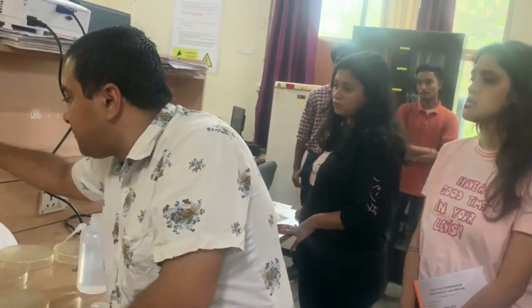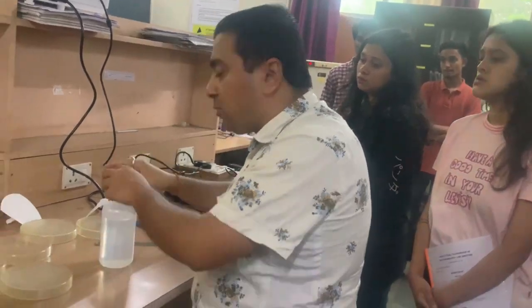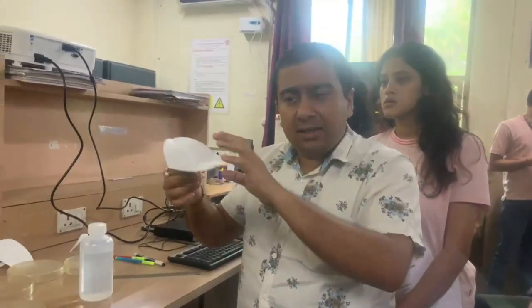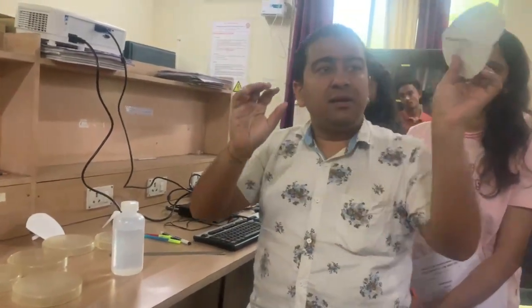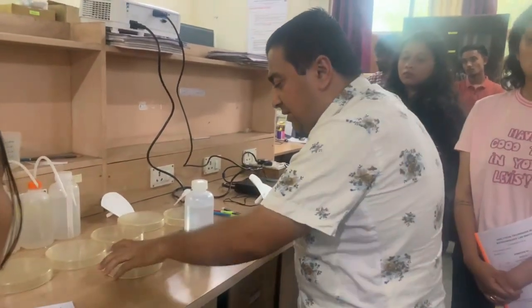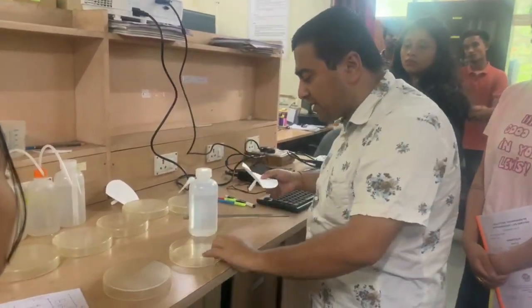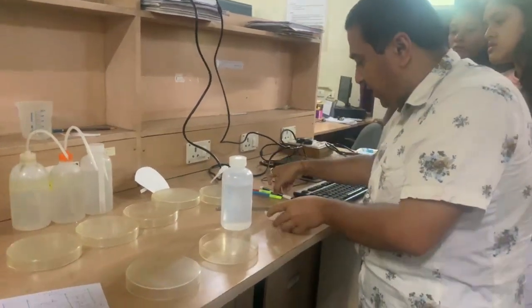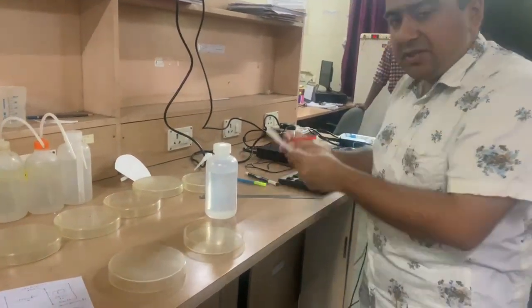The second point is, how will you be able to do radial chromatography? For that, what you do? You have to cut this and make a hole like this, so that the support comes here. So this is a petri plate. Okay, what to do is very simple. First, you move the support. Okay, everybody, the support is moved.